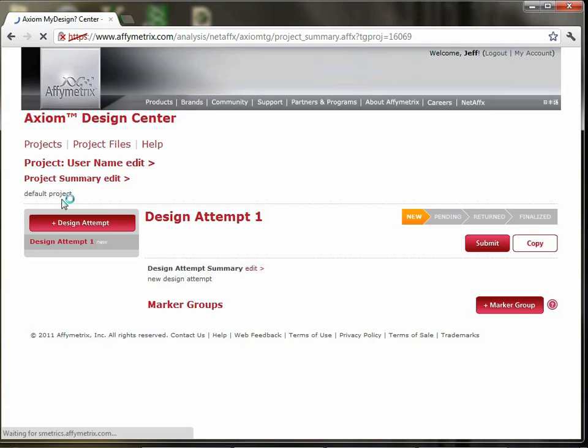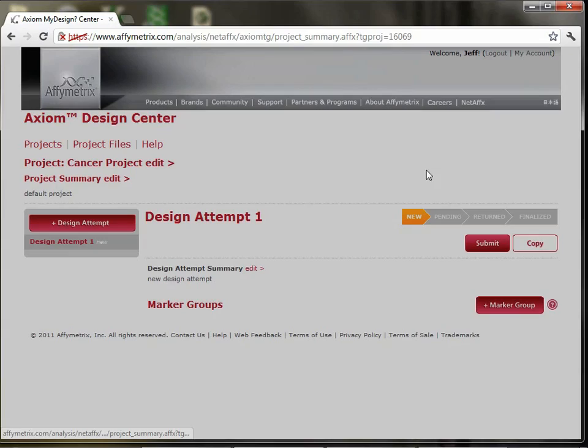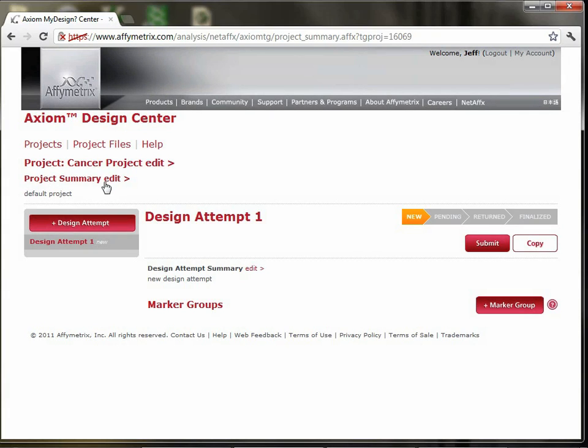Now, having a project with your individual username is not particularly useful, but we have the ability to change the name here. So again, you can see the navigation stays the same, but now you can see we're in this particular project, which is called username. We'll click on edit so we can change the name of that to Cancer Project. And if you want, you can choose to add a project summary here that will describe what was specific about this project and what's going on with it.